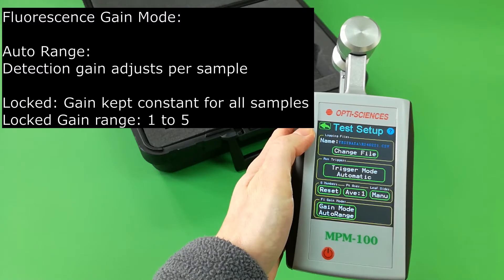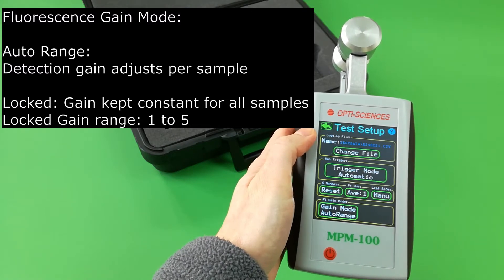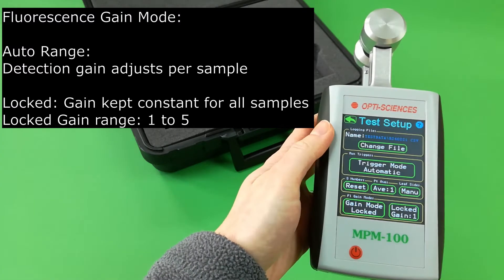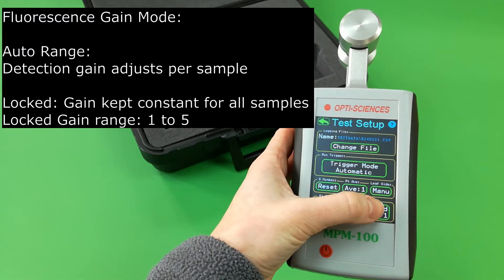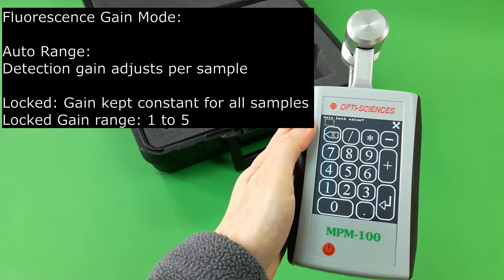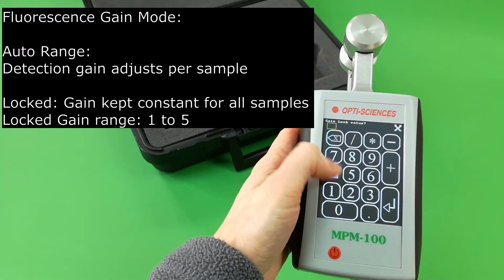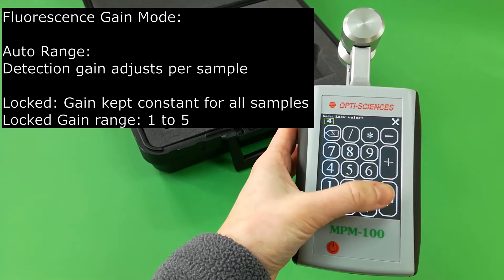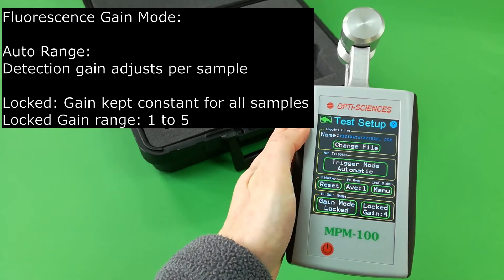Select the fluorescence gain mode: either auto range, whereby detection gain adjusts for each sample, or locked, whereby gain is kept constant at a value of 1 to 5.